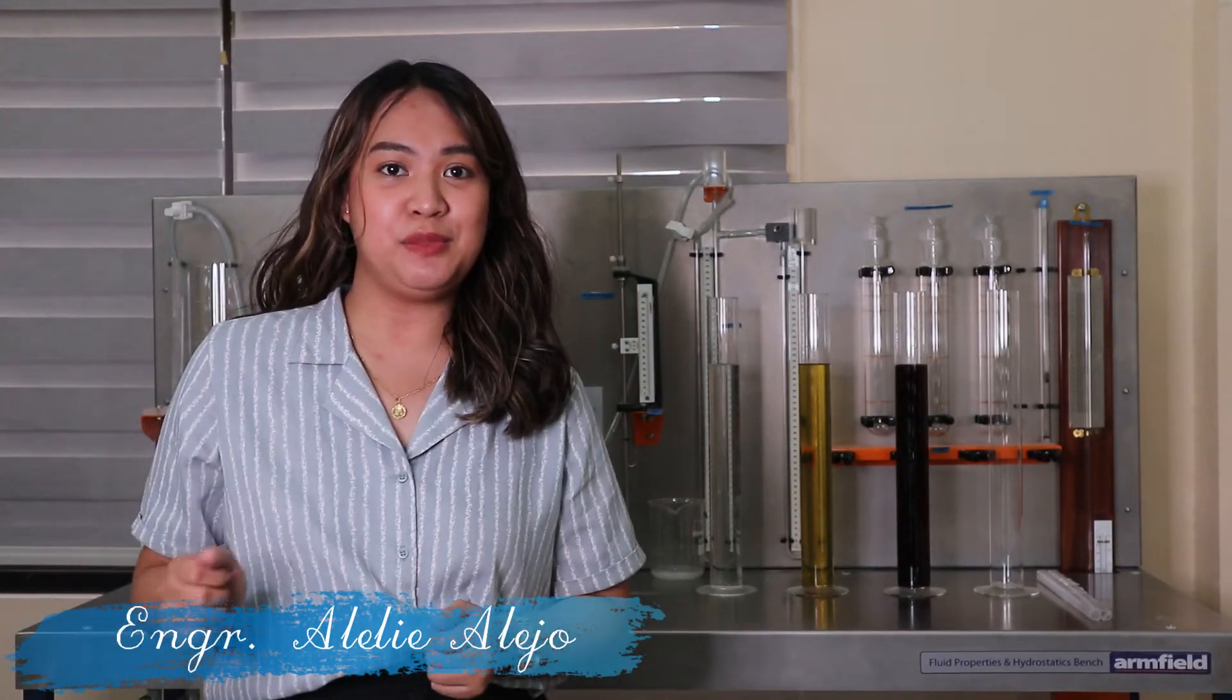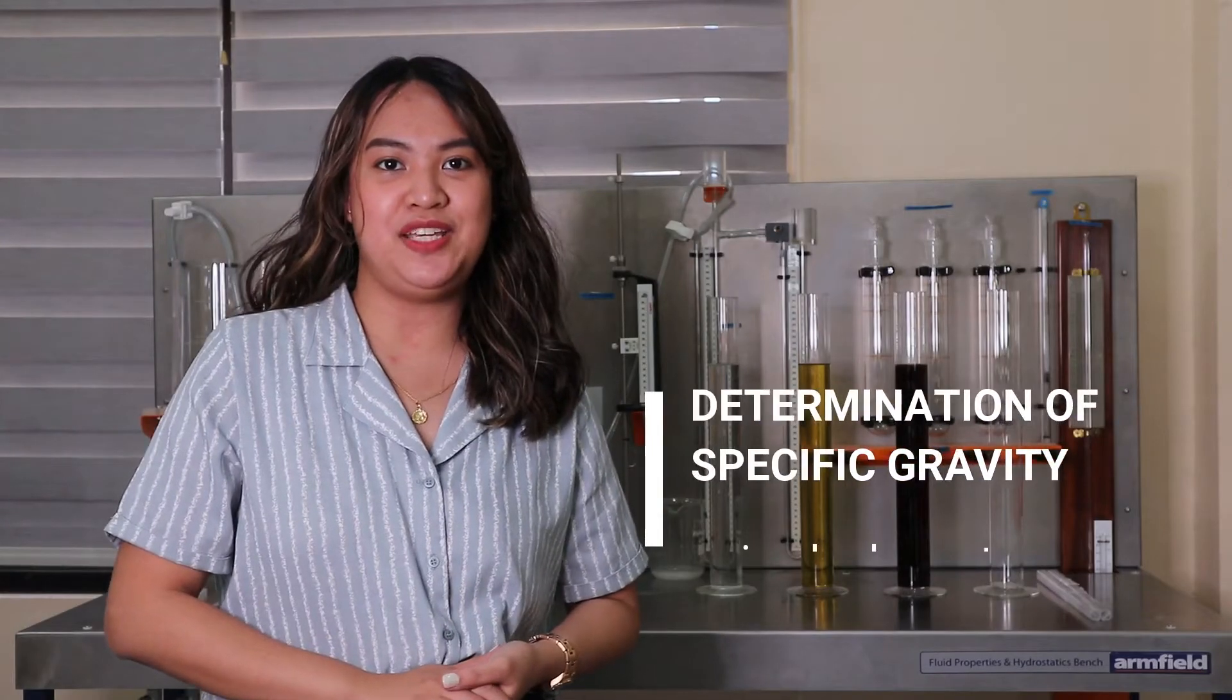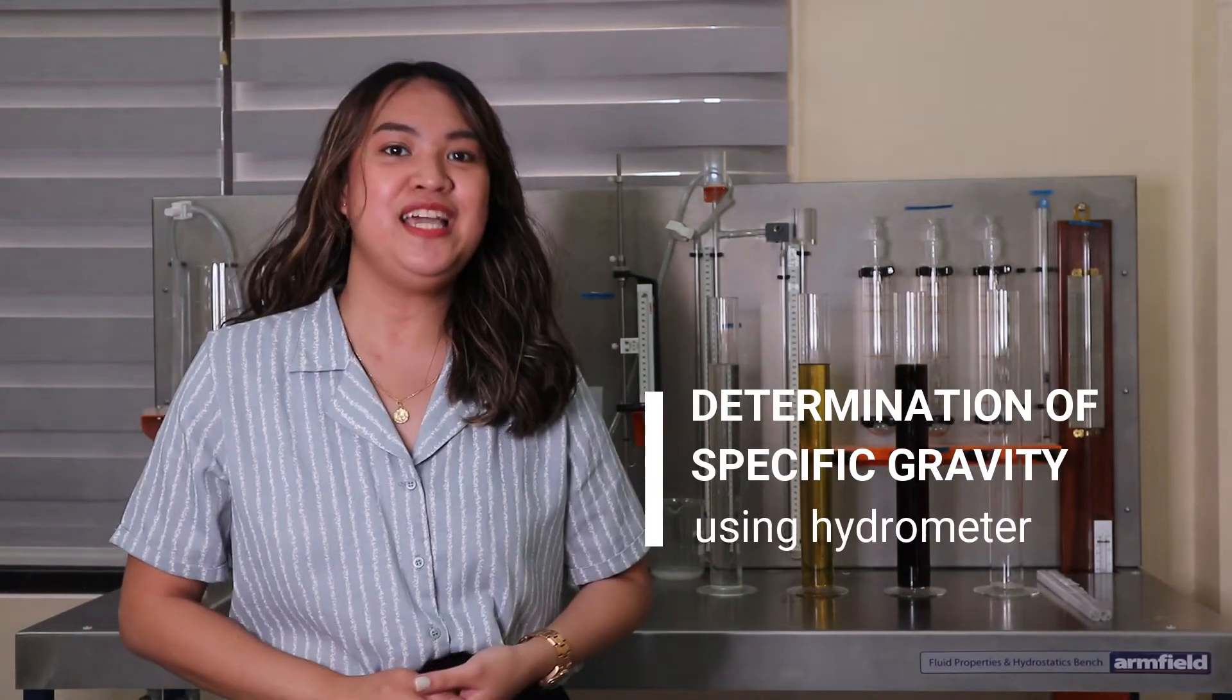Good day everyone! For today's video, we are going to perform the determination of specific gravity using hydrometer.